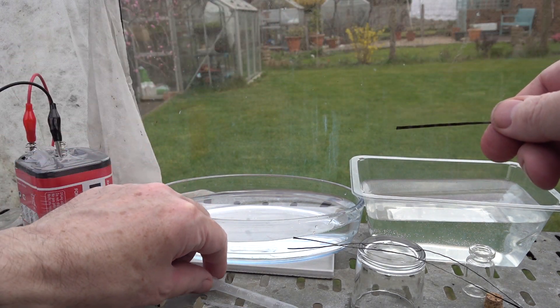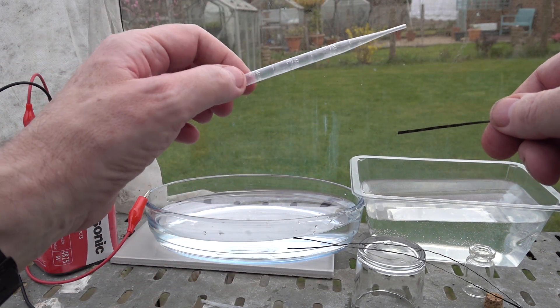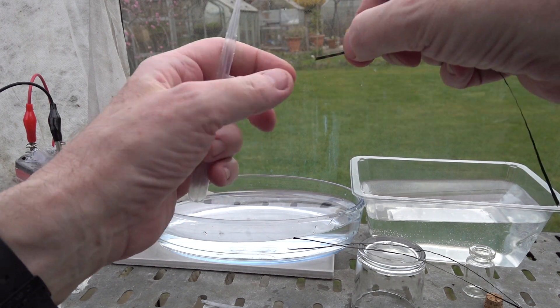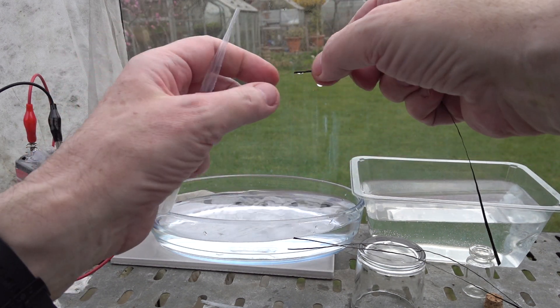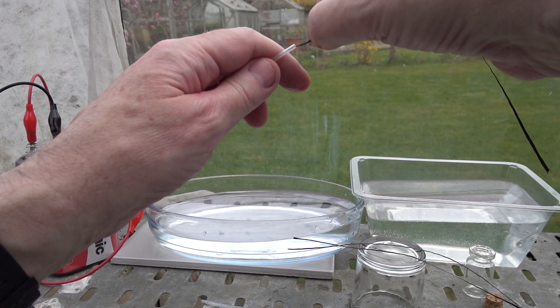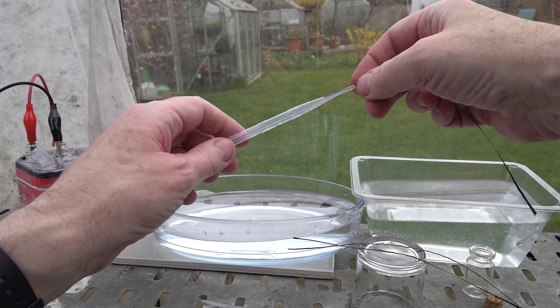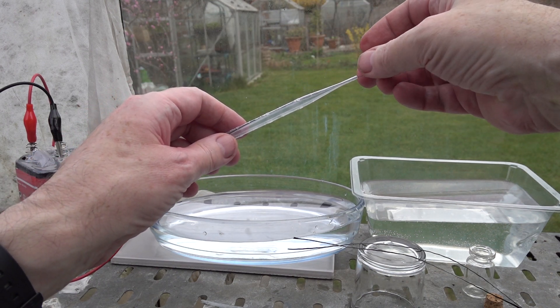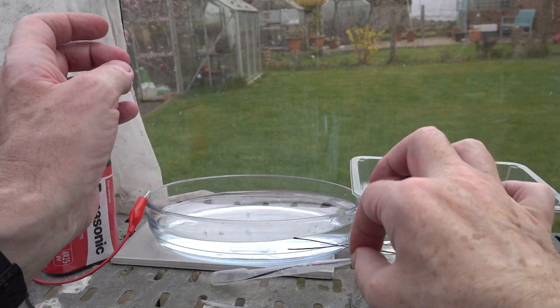In essence, the electrode is made just by taking a plastic dropping pipette and inserting the carbon fiber. It helps to moisten the end like threading a thread through the eye of a needle. There we have the concept of the electrode.